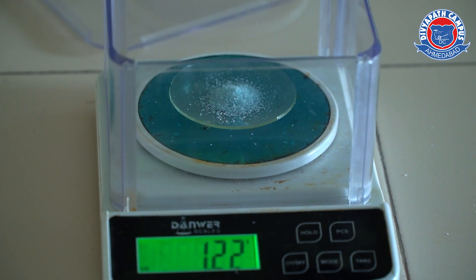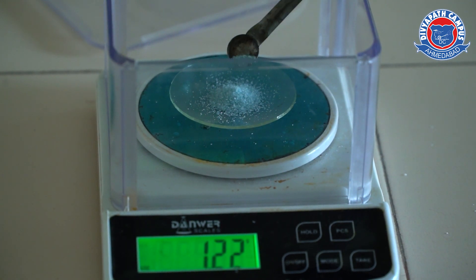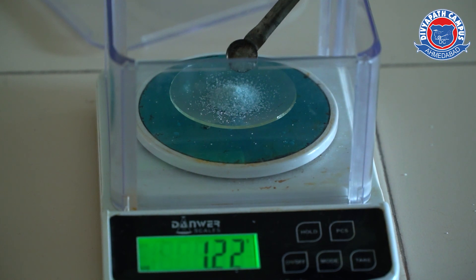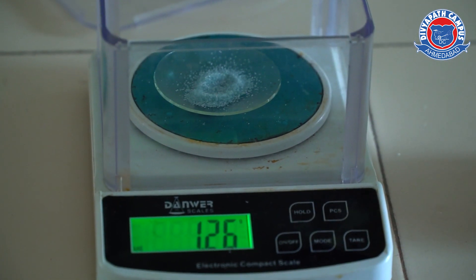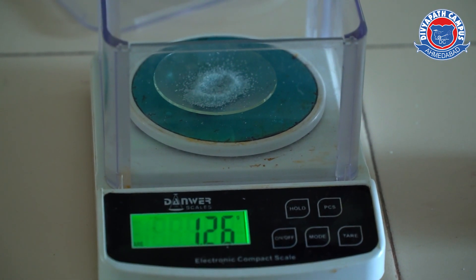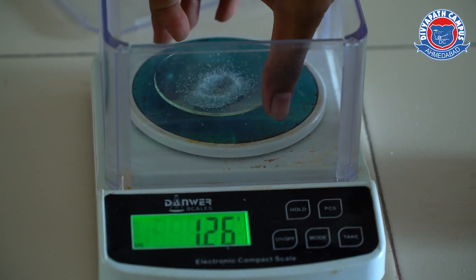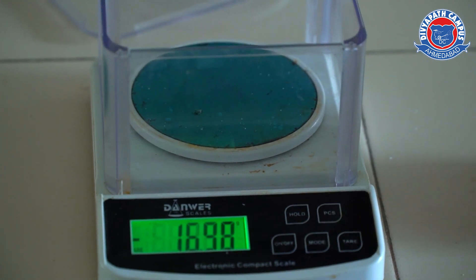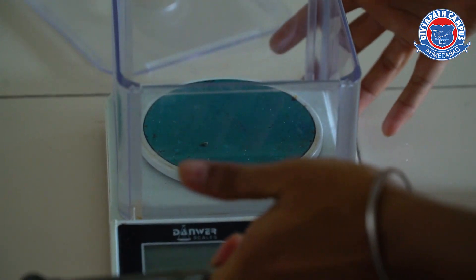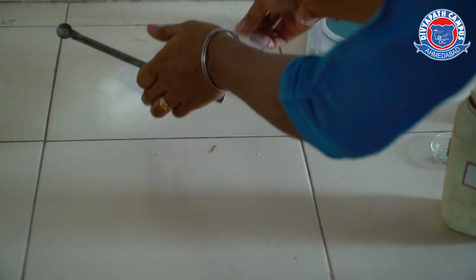Now it is 1.22, so we will slowly transfer a small amount of powder until we reach 1.26. Now it is 1.26 grams of oxalic acid powder and we will remove it from the weighing balance.